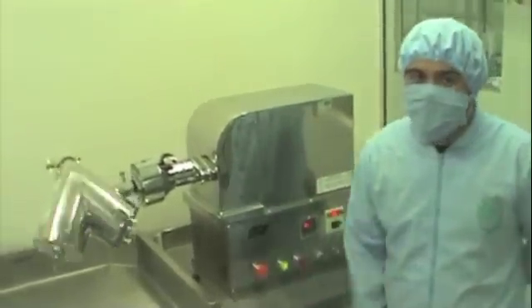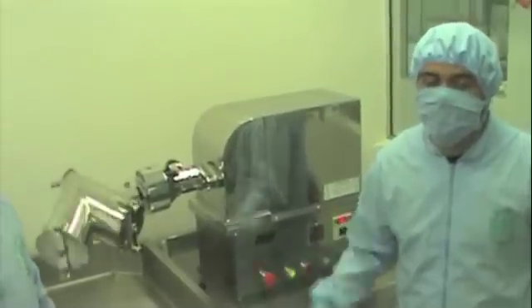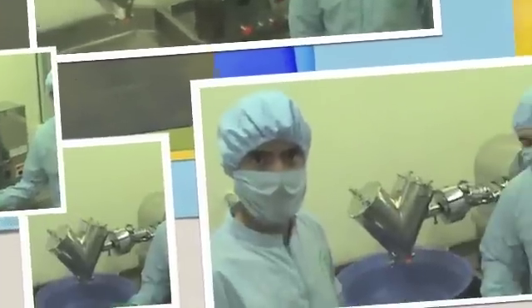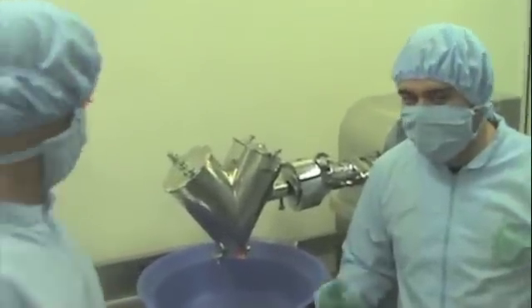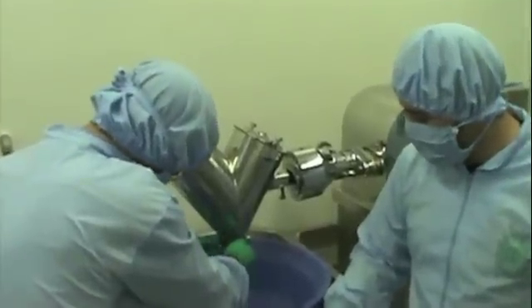The objective of this step is to homogenize the mixture so that the final dosage form has uniformity in all its ingredients. Now that we have blended the mix, we're going to see the final product, how it went.